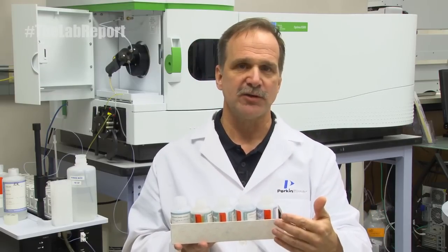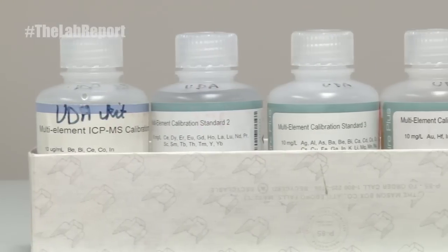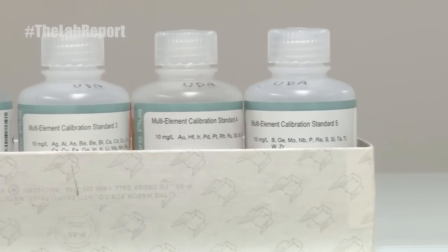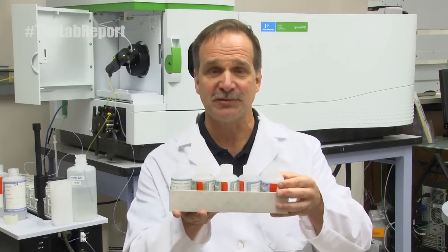You might be asking, how can you process something that you didn't run initially? You don't have a standard. Well, we sell a kit called a UDA kit — when you mix these together one to ten, you have a 1 ppm solution of the whole periodic table. You run this along with your samples as a sample, and you can reprocess it later as a calibration standard. So if someone asks for an element that you didn't initially report, you have a way to quantitate that element. You simply go back, add it as a calibration standard after you add the element, reprocess your data, and now you have the element the customer asked for — without having to rerun. You did in 30 seconds what you normally did in 30 minutes.